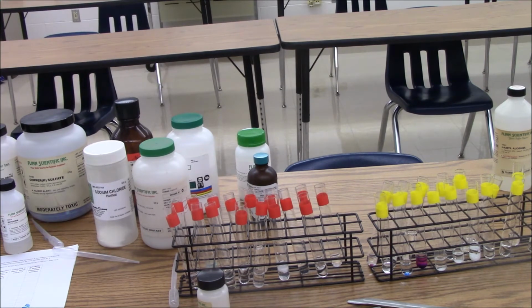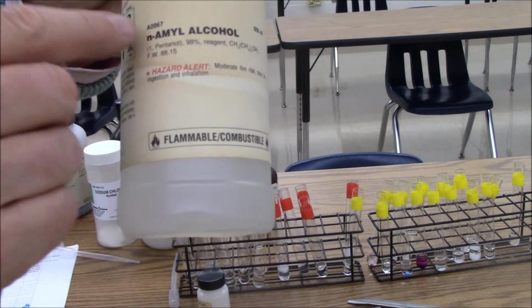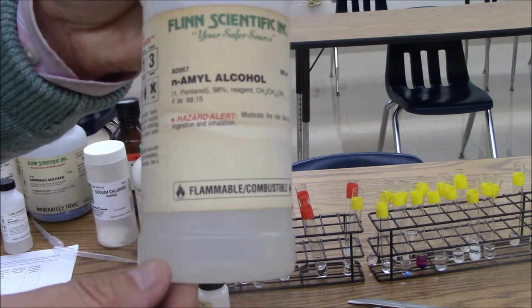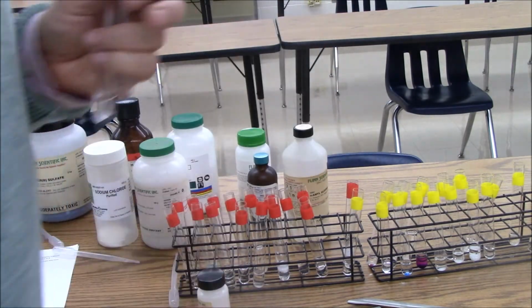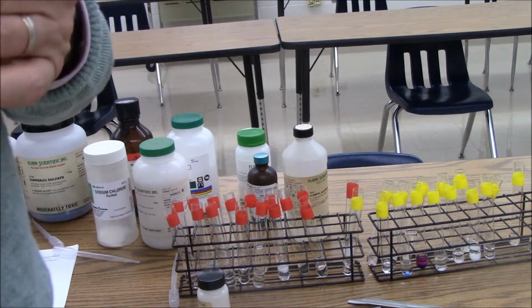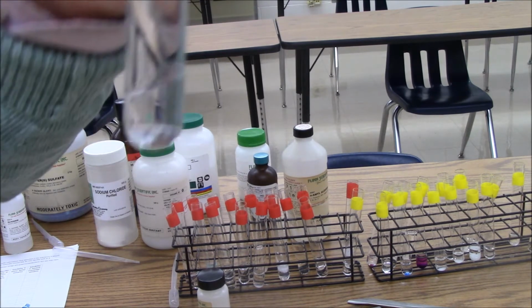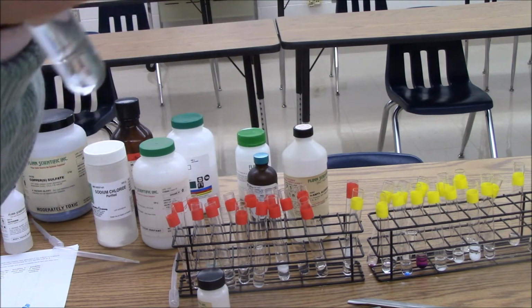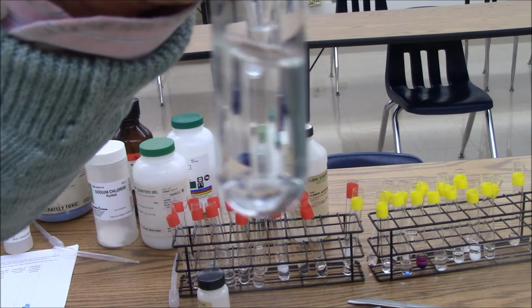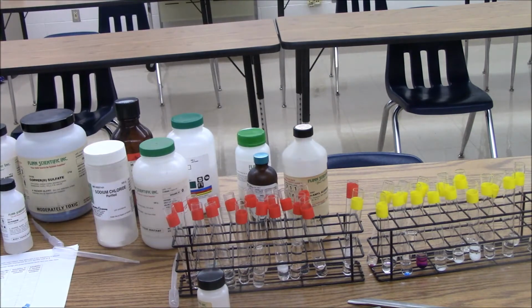Next up, we're going to try pentanol. So here's my bottle of pentanol. It sometimes is called amyl alcohol. That's its old unofficial name. You'll see pentanol underneath it. It's got an alcohol group on it, so it can form some hydrogen bonds, but it also has enough hydrocarbon characteristic that it will not dissolve, and you can see the boundary layer. But it dissolves nicely in the hexane. So we've still got this pattern going where things either dissolve in one or the other.